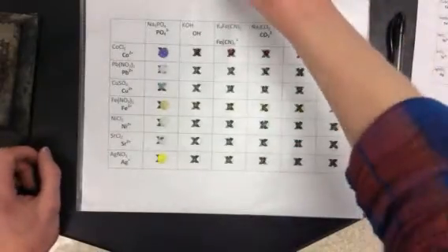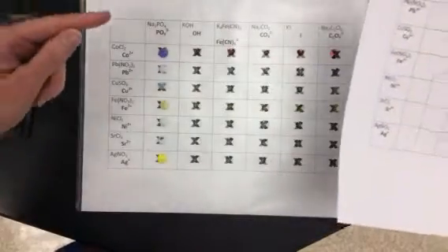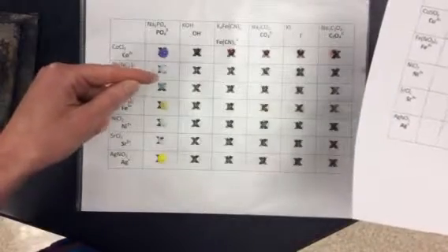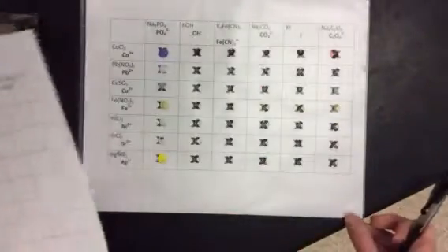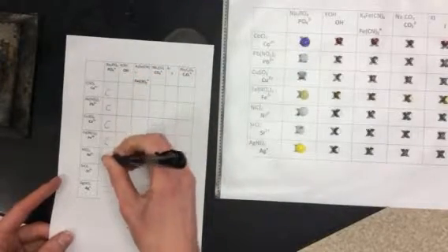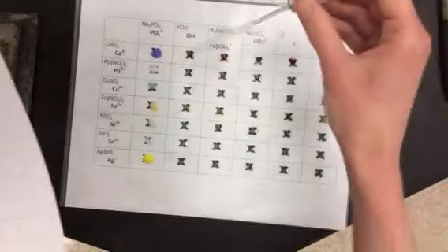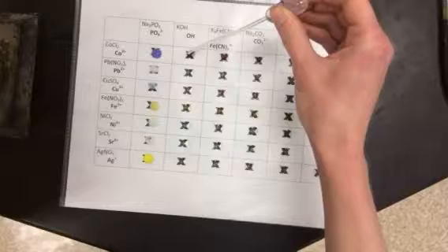Okay, so if we look at these, actually every single one of these is cloudy. Even this one that looks kind of clear, if you look really closely, you can see that it's not transparent. You can't quite see that X. So on my data table, I would record all the way down this row, C, C, C, C, C, C, C for cloudy. Okay, so I'm going to just go through. I expect that you know how to fill out the data table now, so I'll just kind of silently do these reactions.